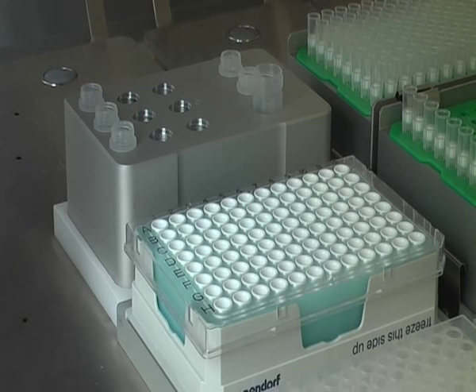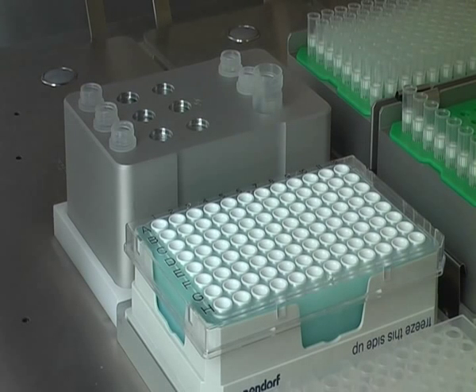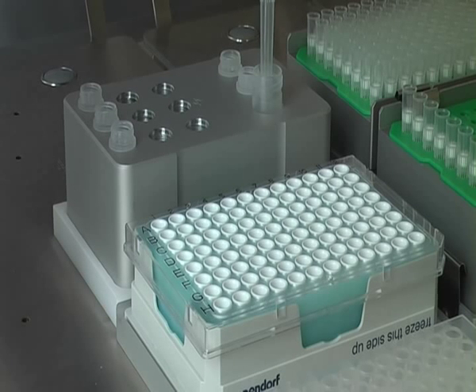First, the internal control is pipetted into the 5 mL working tube. This internal control serves as an amplification control to avoid false negative PCR results.